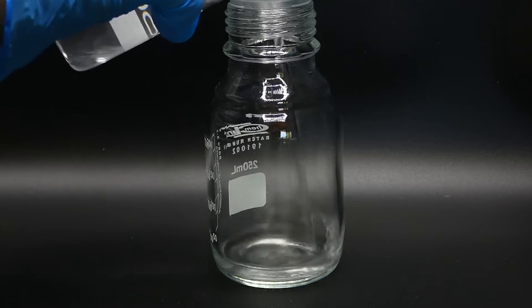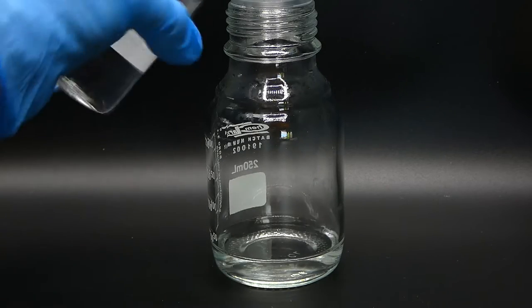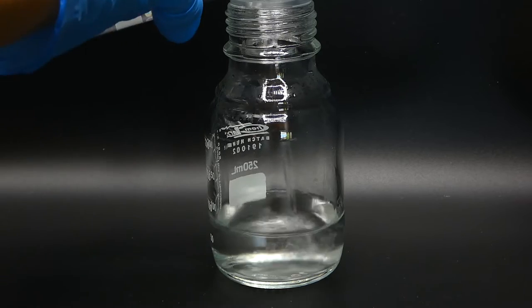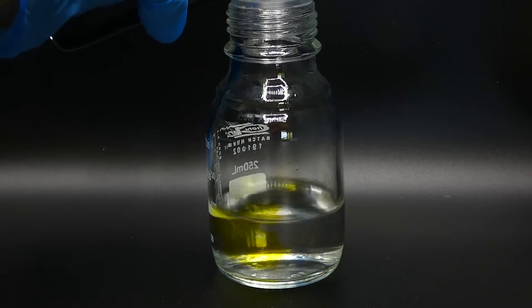When all the solutions are ready, you can pour equal amounts of the sodium hydroxide and glucose solution together into a container. The amount of the dye solution added depends on how intense you want the color to be.